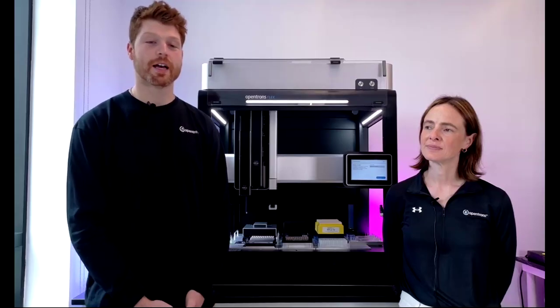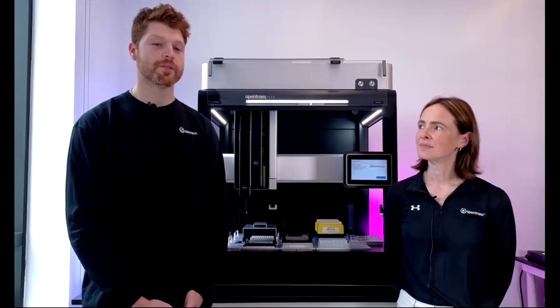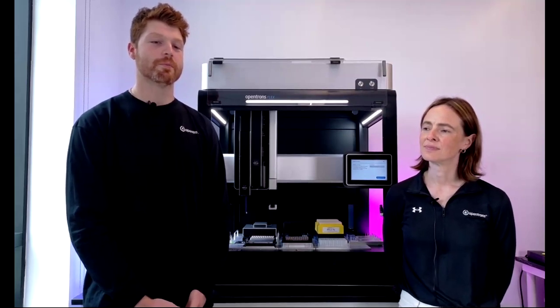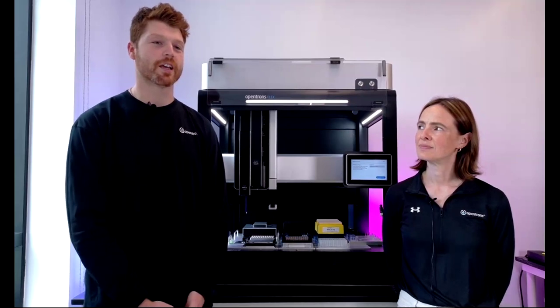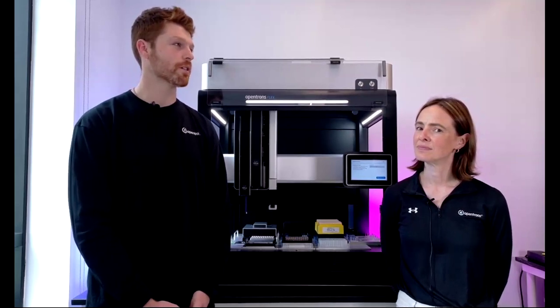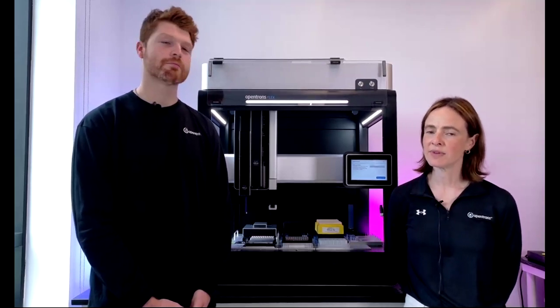That's definitely a good feature call out. I do believe that we've done some work internally on this feature already, but that is definitely a good use case to explore more. Yeah, I don't know Nick, if you had anything to add.